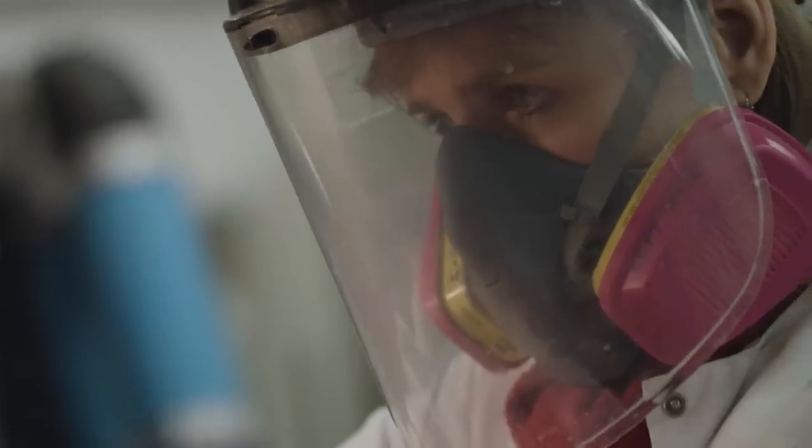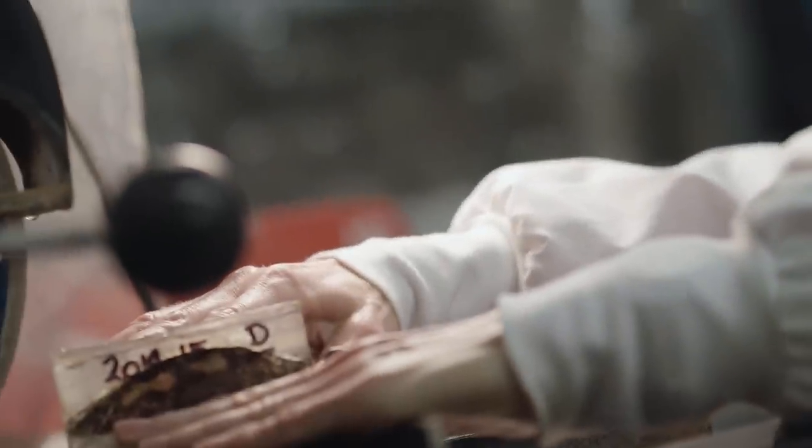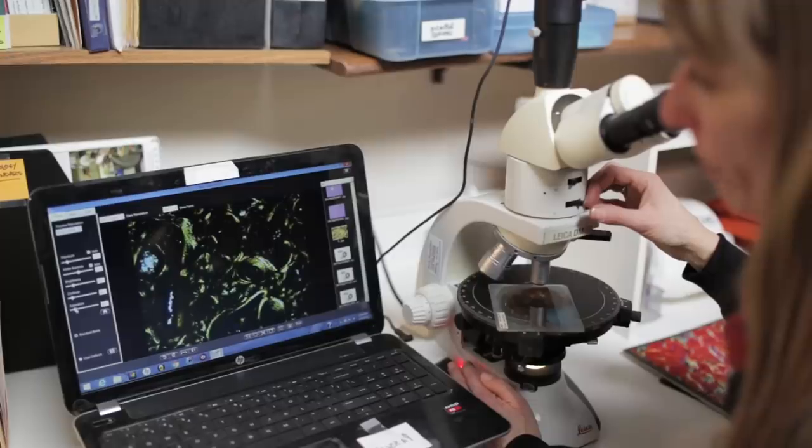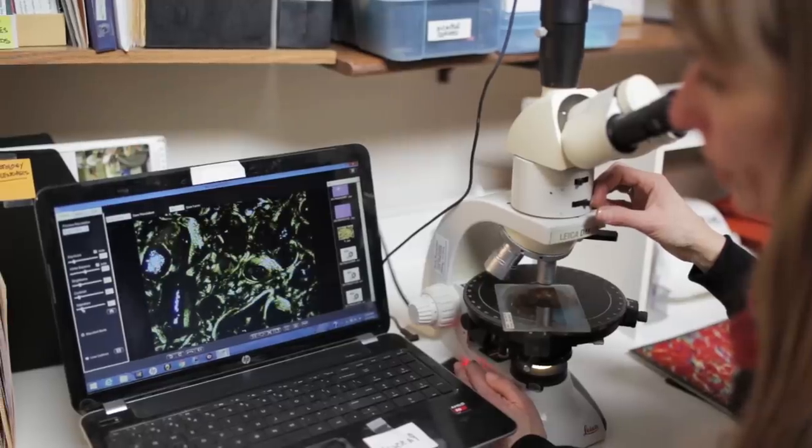So let's just jump right in. What is histology and what is paleohistology? Histology is the study of the microscopic structure of biological tissues. And in paleohistology, we study the microscopic structure of fossil remains. Paleohistology is essentially used as a tool within paleontology to answer deeper questions about dinosaurs and other ancient life on Earth.